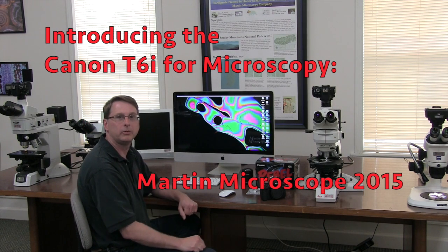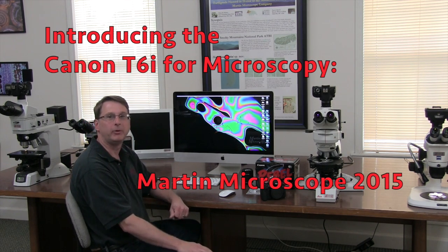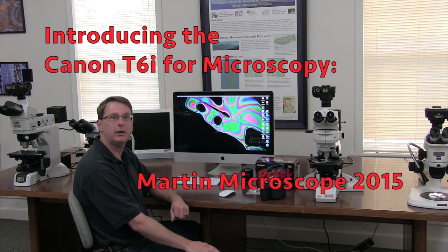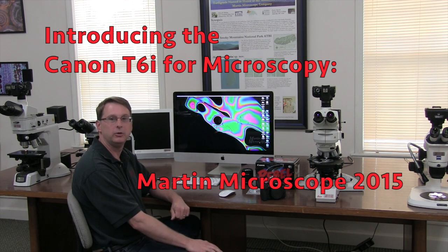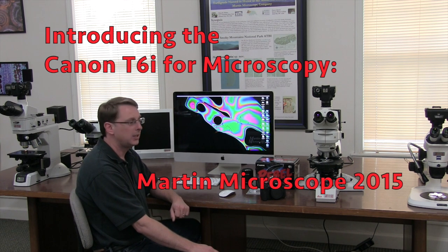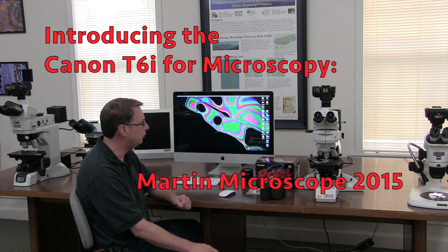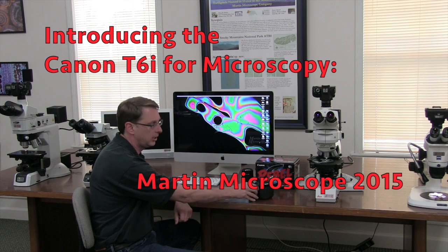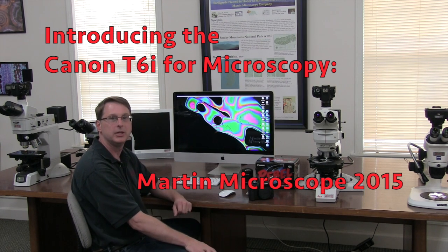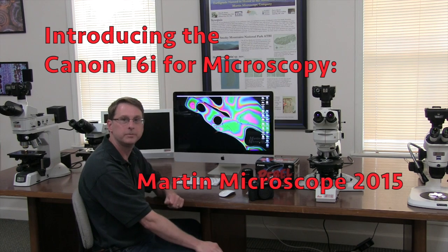Hi, welcome to Martin Microscope Company. I'm Bobby Martin and we just got a new camera in and I would just like to show everyone, our YouTube viewers, how easy it is to get one of these digital SLR cameras with one of our microscope adapters set up on your computer and start taking pictures.